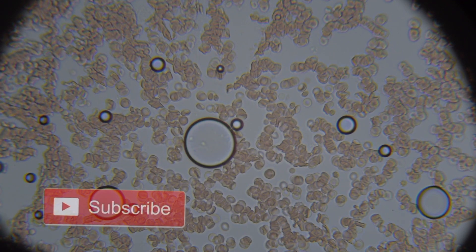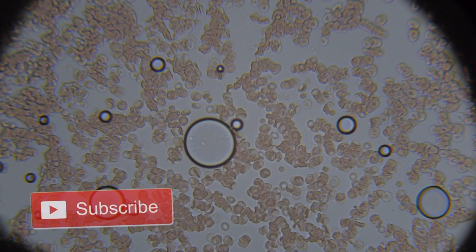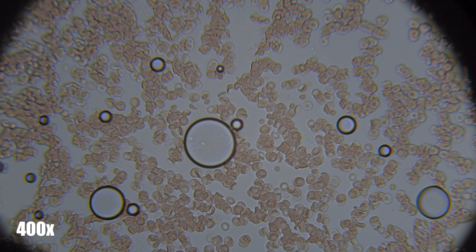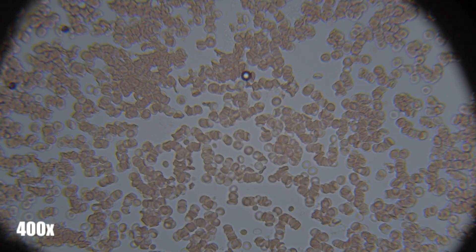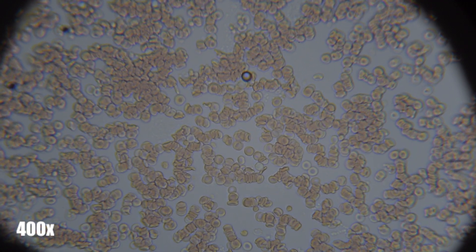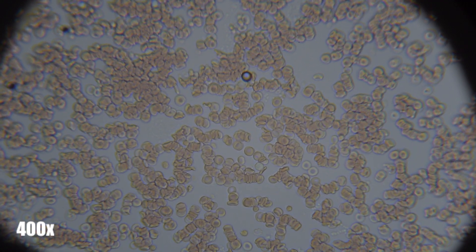These images were obtained by performing a blood smear. Some medical professionals would look at similar images through their microscopes to diagnose some different forms of diseases, such as sickle cell anemia, which this sample shows negative. Sickle cell anemia would have curved blood cells, rather than the round plump cells shown here.